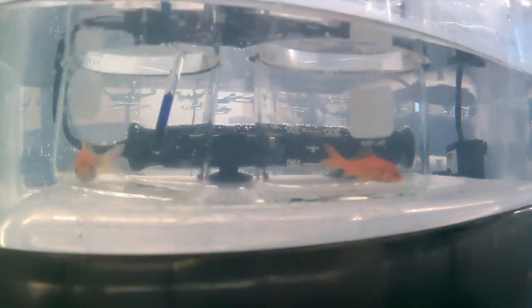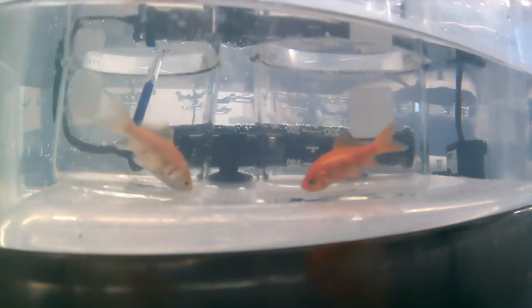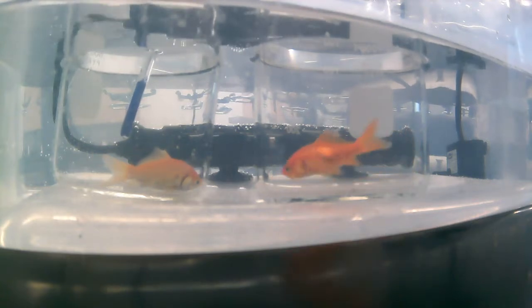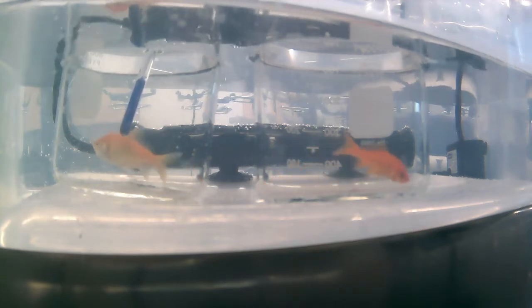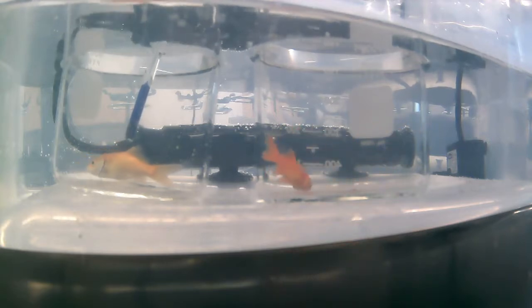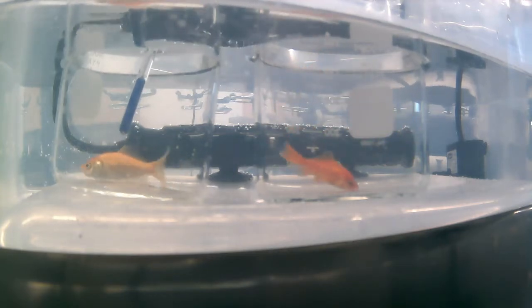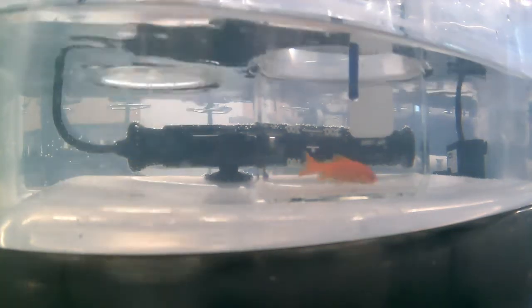So at this point in the procedure, you can see that the fish is now relegated to just short bursts of movement and has lost the ability to escape the conditions that ultimately will result in its death. And so we're going to take this temperature right here as the muscle spasm temperature. 36.8. So 36.8, and we're going to pull them out and restore them back to the acclimation temperature.